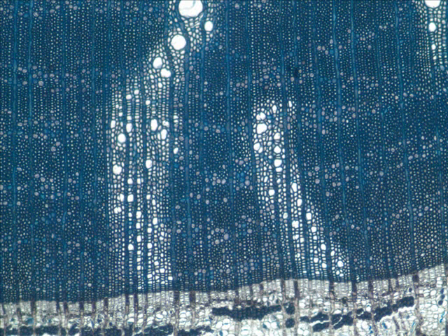What's this down here? Secondary xylem or secondary phloem? It is the secondary phloem. What's this up here? It is the secondary xylem. Yes, and we see several different kinds of cells in the secondary xylem. Let's take a closer look.